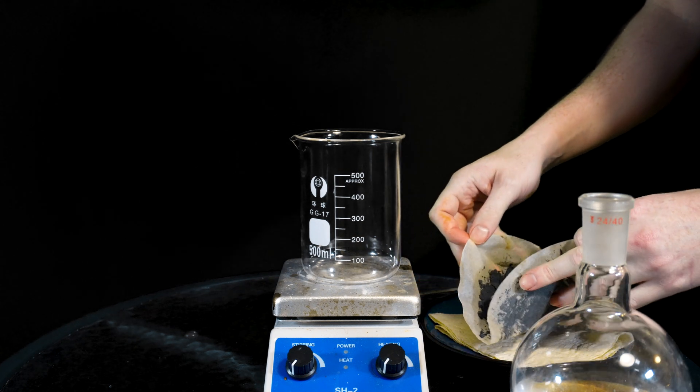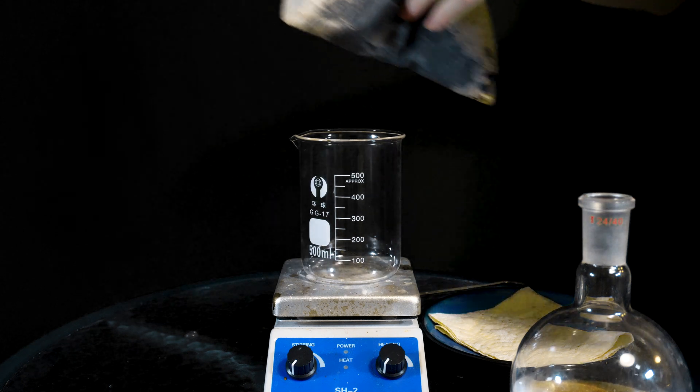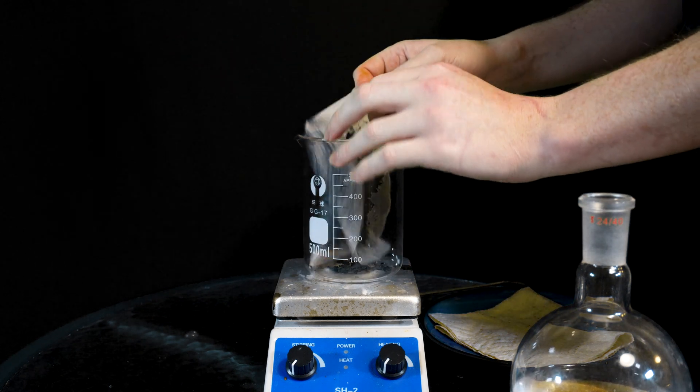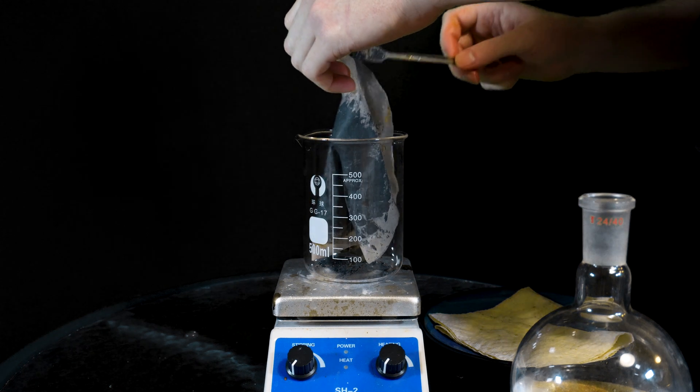To purify our iodine we'll need to heat it up which will cause it to sublime. If we heat it up enough the iodine will actually liquefy, vaporize, and then condense. But we'll just heat it gently.